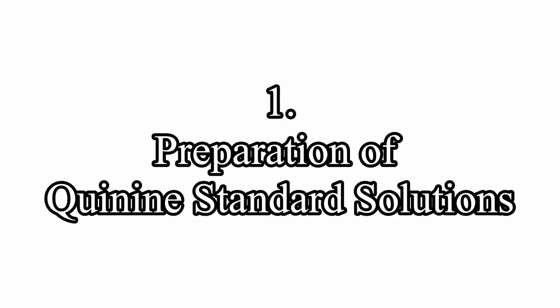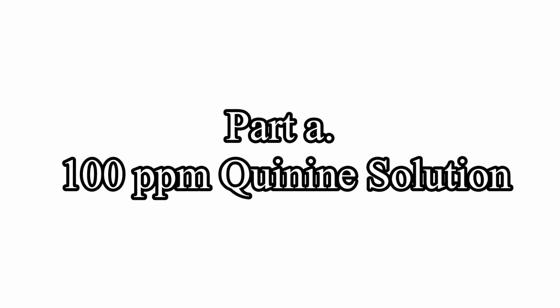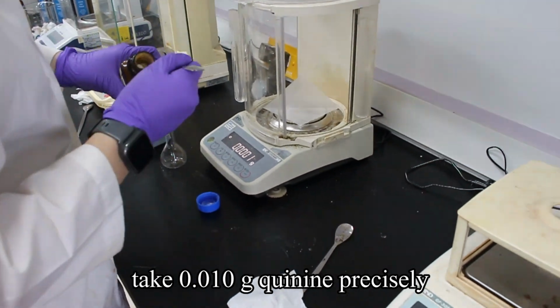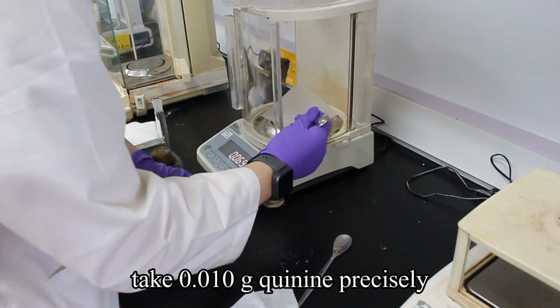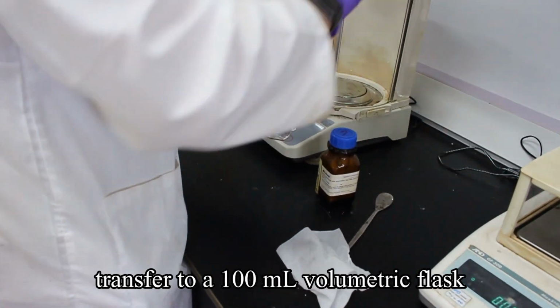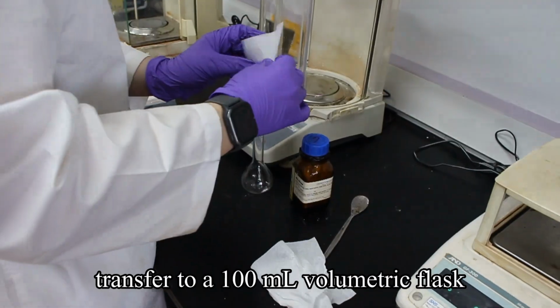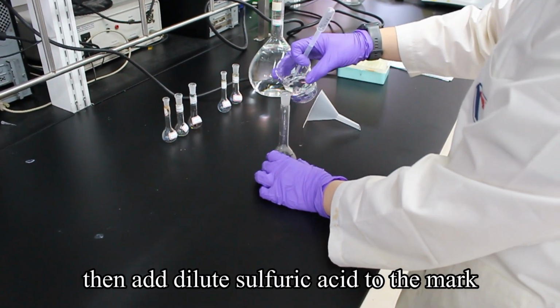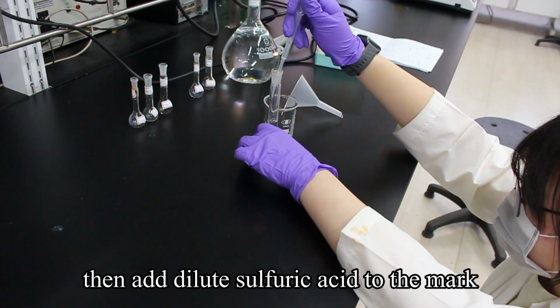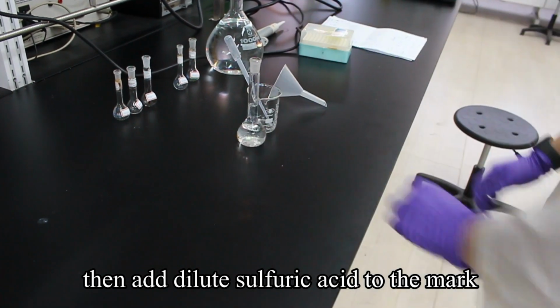Step 1. Preparation of quinine standard solution. Part A. Prepare 100 ppm quinine solution. Take 0.010 g quinine precisely. Transfer to a 100 ml volumetric flask. Then add dilute sulfuric acid to the mark. Mix well.